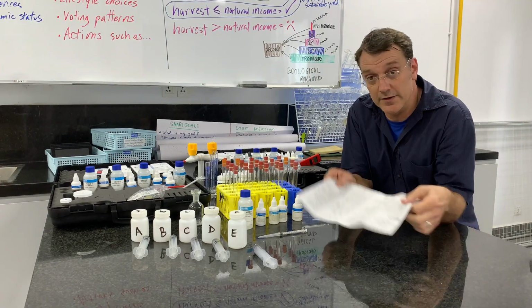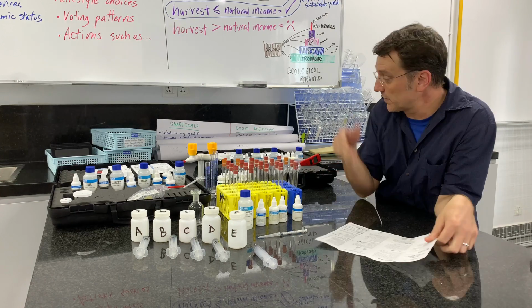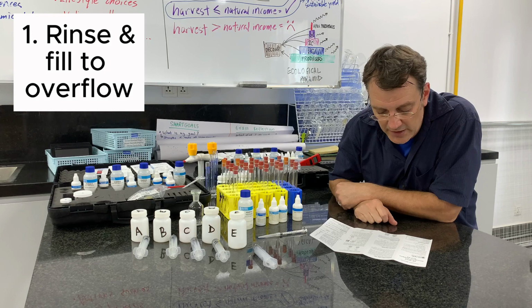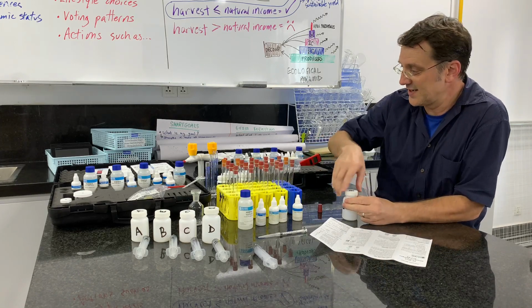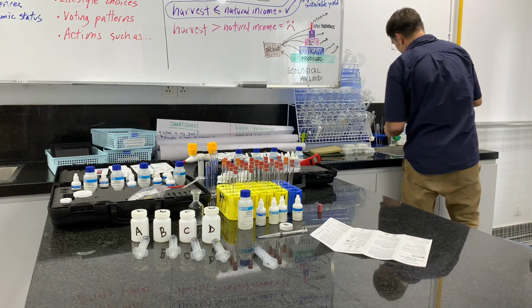What I am doing here is I'm reading and following the instructions in the manual that comes with a test kit. Rinse your glass bottle 3 times with your water sample and fill it to overflow. So this is my sample. I'm choosing my sample E, and I'm simply going to come over here to my sink.